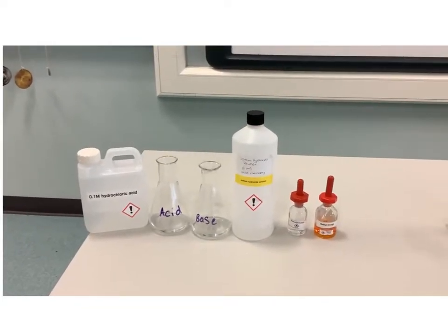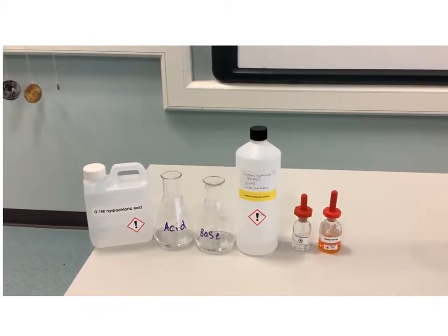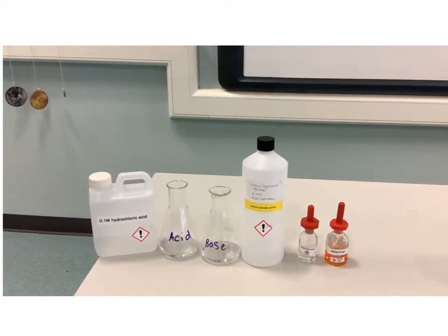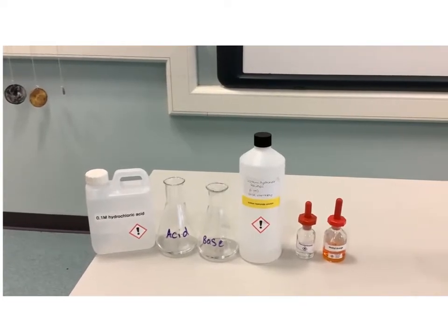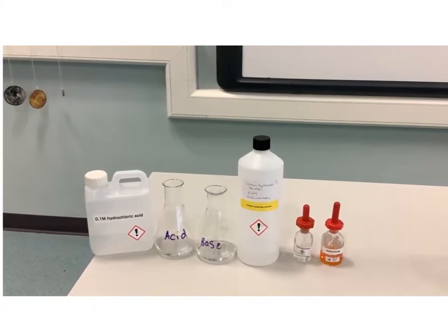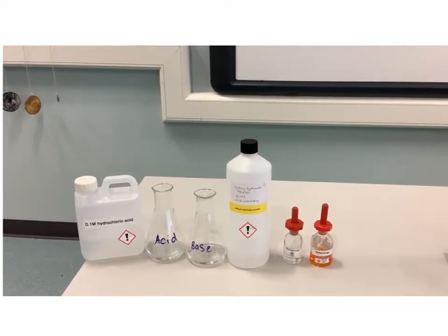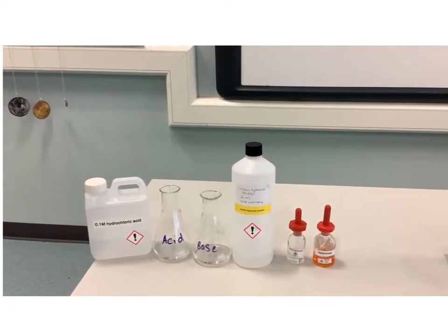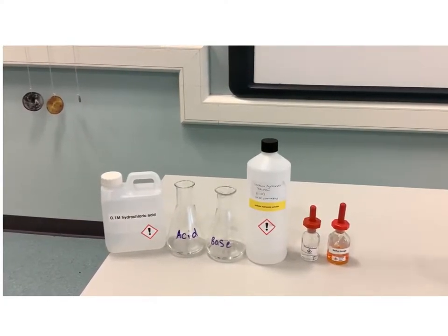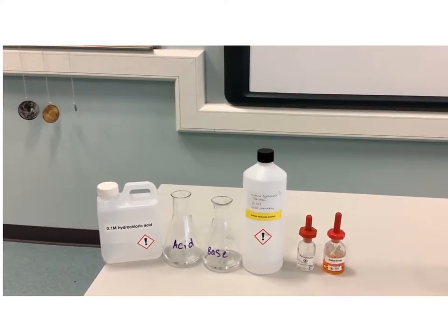In this video I'm going to demonstrate the color changes involved with titrations and how that is dependent on which solution we start with in our conical flask and which we start with in our burette. The chemicals I'm using are hydrochloric acid as my acid and sodium hydroxide as my base or alkali. The two indicators I'm going to demonstrate are phenolphthalein, which you perhaps met at GCSE, and methyl orange. I have measured out 25 mL of my acid and my base into a conical flask, and I've got two sets of these to demonstrate the two indicators.